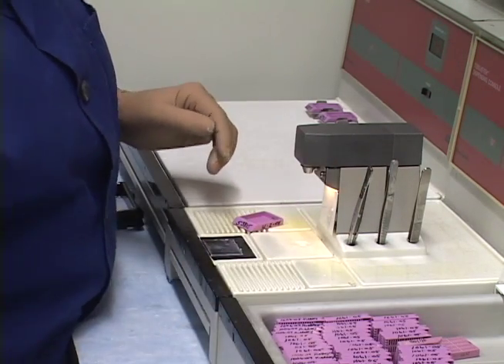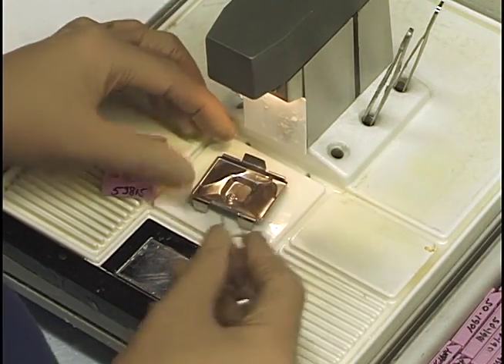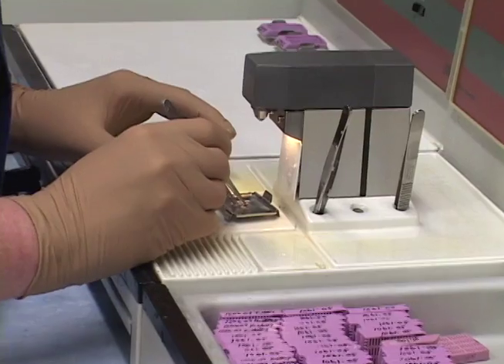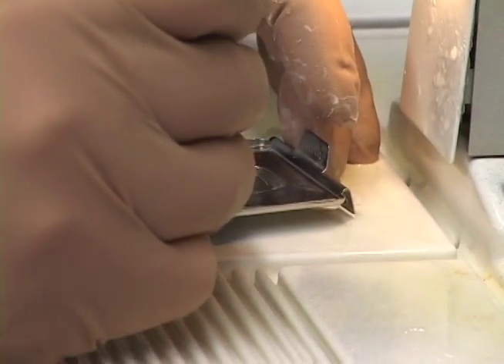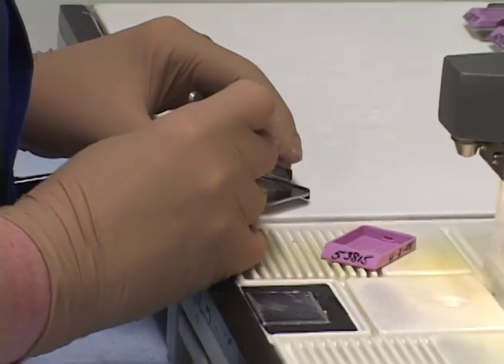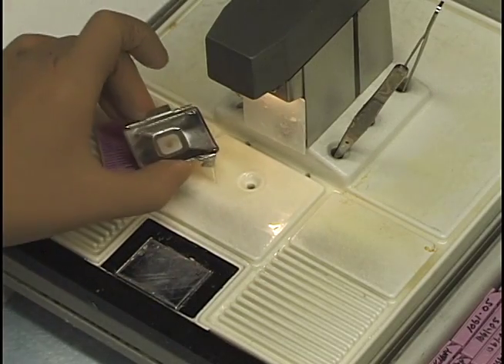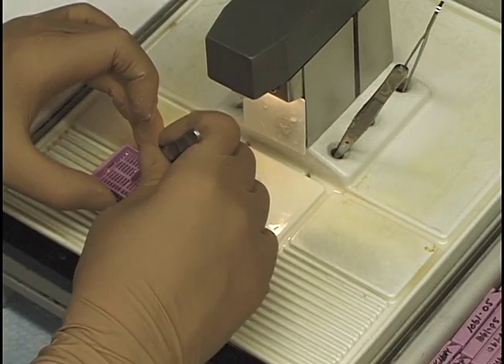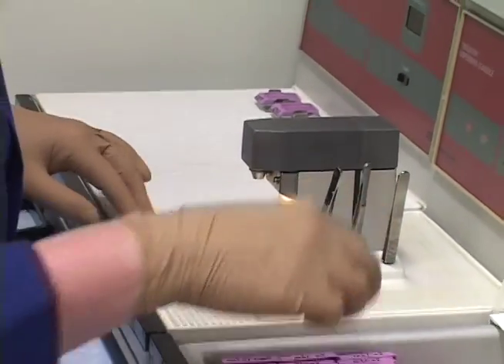I see there's nothing on the lid. I put a little paraffin in the bottom — you can put just a little or fill it; you'll just have messier edges by filling more. I get it nice and centered, doing this one sagittally. I go to the colder area to chill it quicker, get the lid on top, and add just a little more paraffin.